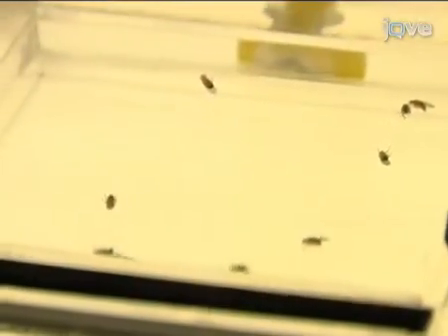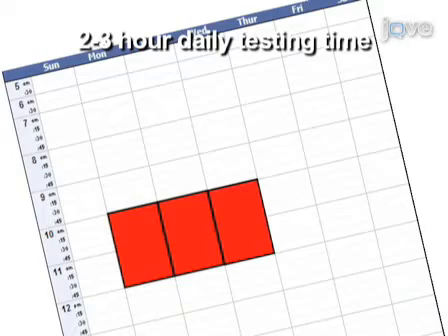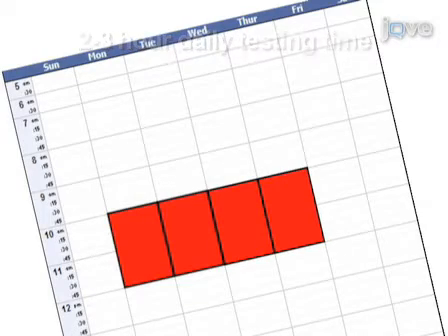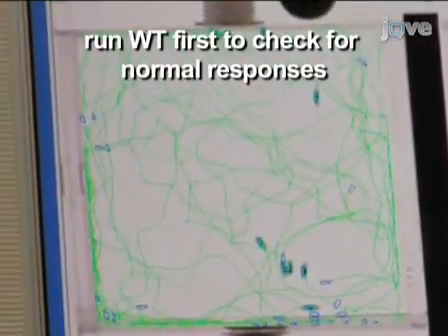We've just shown you how to set up and run a locomotor video tracking assay. When doing this procedure, it's important to remember to perform the assays within the same 2 to 3 hour time window each day in order to avoid circadian rhythm issues. And always run wild-type organisms first to make sure that the behavioral responses are within the normal range on a given day.